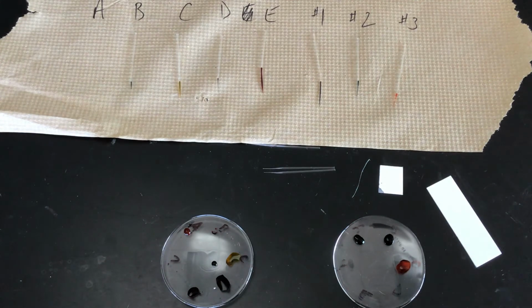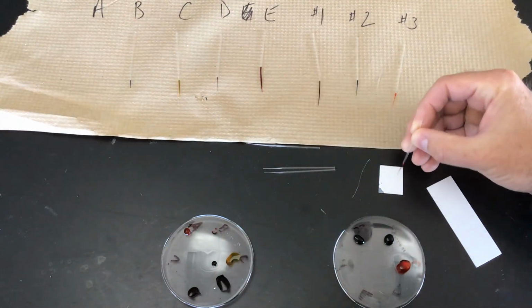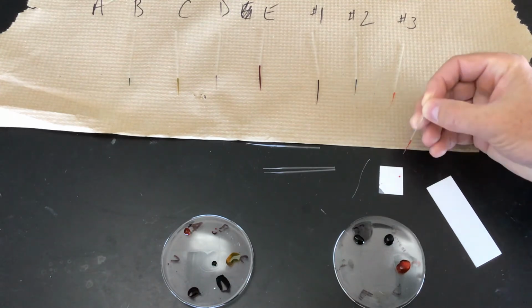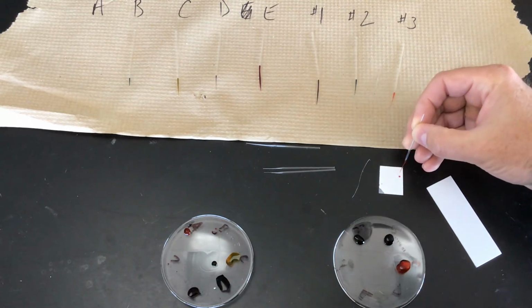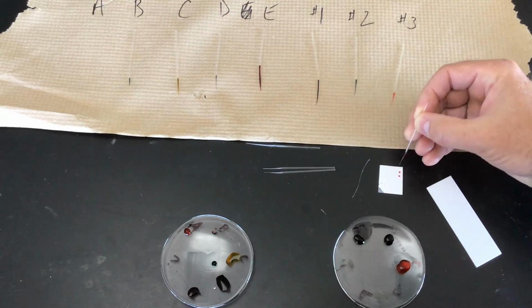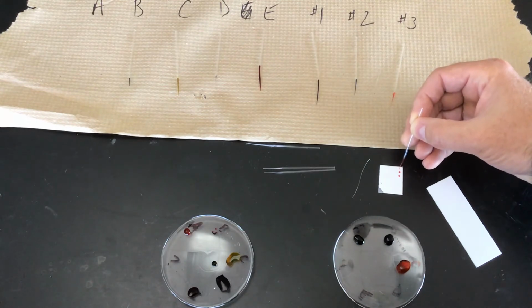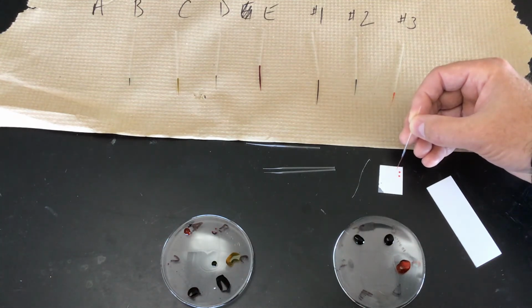If we were to grab this one and you just want to practice, like on a little piece there, practice putting down some of the dye. So I would probably say, let's see, maybe I'm just tapping it. These two would probably be an appropriate size. So we don't necessarily need to have a lot on there. We just want to have enough of the dye to see how things separate.